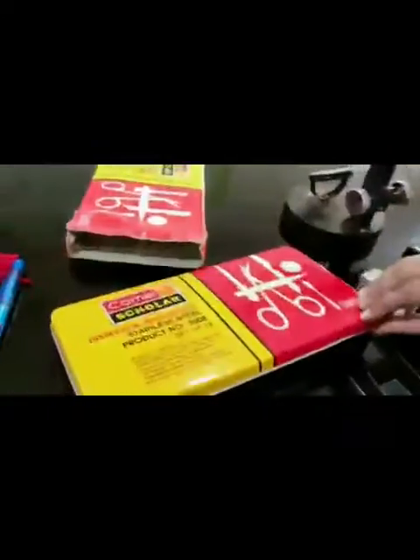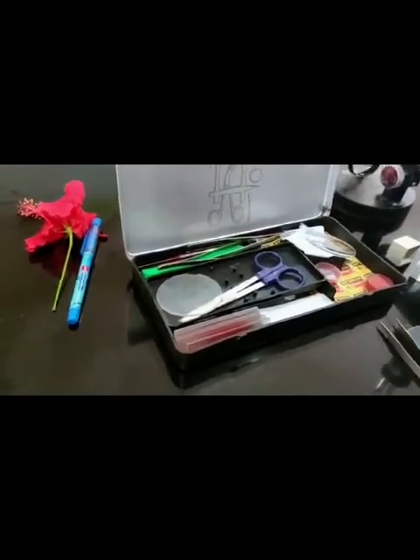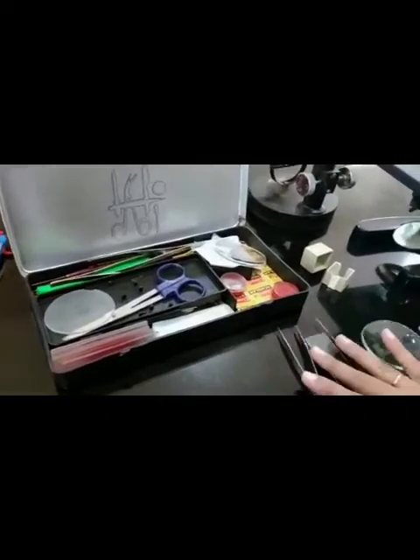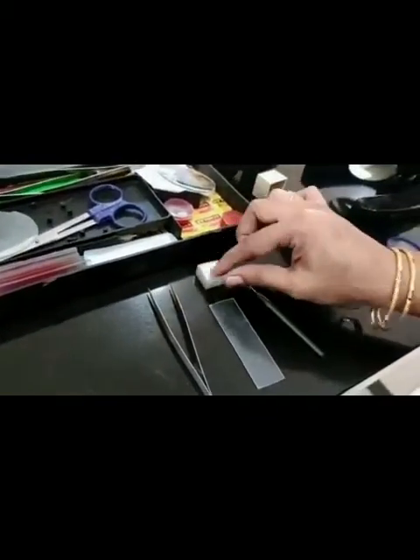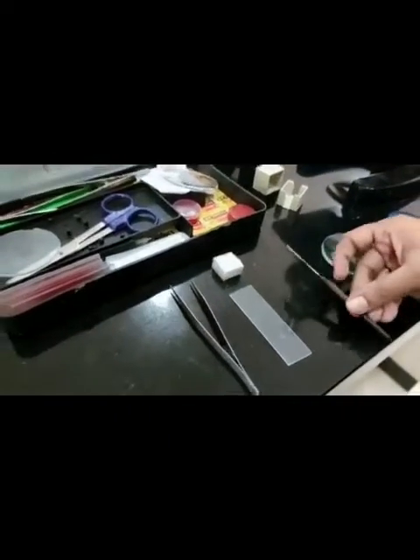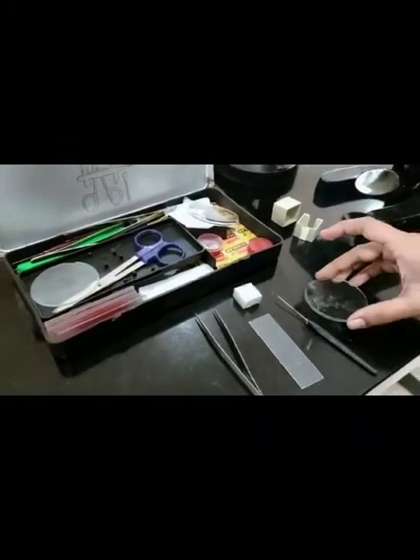This is a dissection box which we use in the dissecting practical in biology. Some of the instruments kept here are: the most commonly used item is the slide, then these are the cover slips, this is the needle — used for teasing the material — then a watch glass, and a magnifying glass.